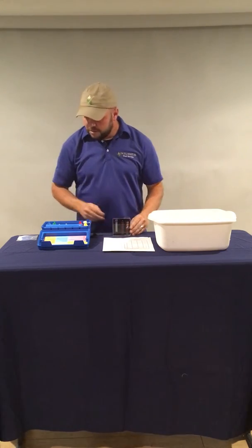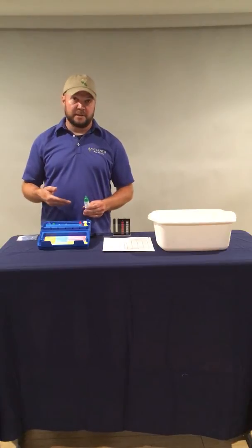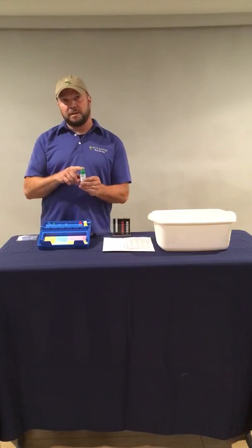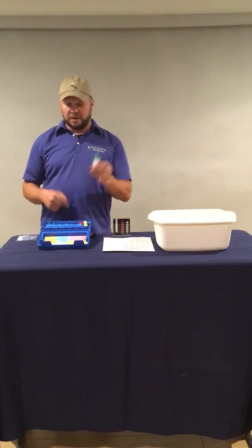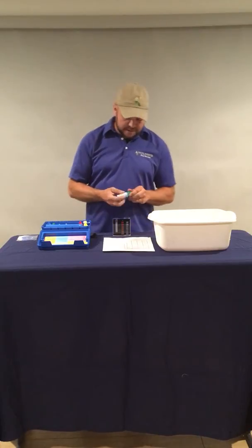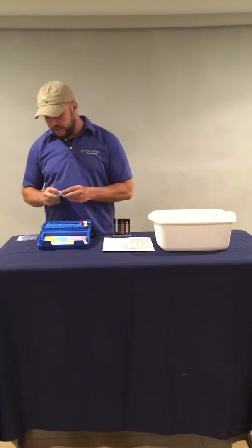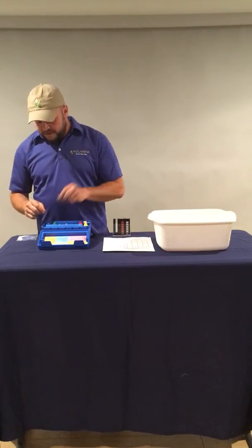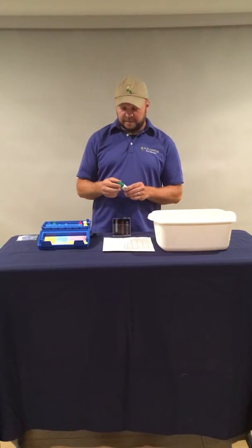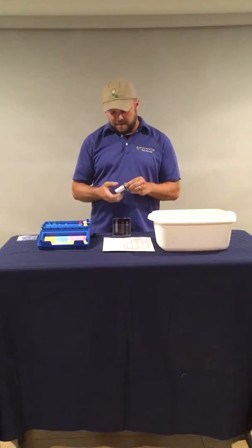Okay. So the first thing, we're going to be using 3 reagents with a green cap on them. The nice thing about this test kit is everything's color-coded. The chlorine test is yellow, pH is red, total alkalinity is green, calcium hardness is blue. So we're going to be using the 3 green cap ones, starting with reagent R7. And we're adding 2 drops of the R7. Cap back on, reagent back in the box so we don't misplace that, lose the cap, knock it over. Then we're adding 5 drops of the R8.